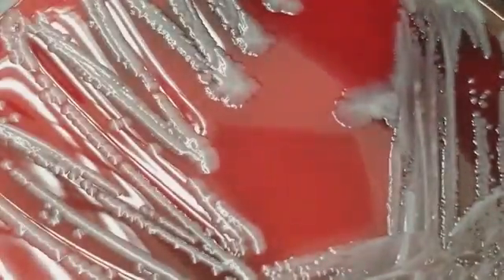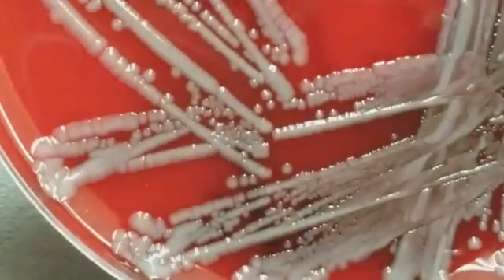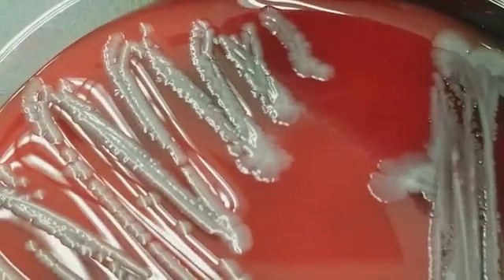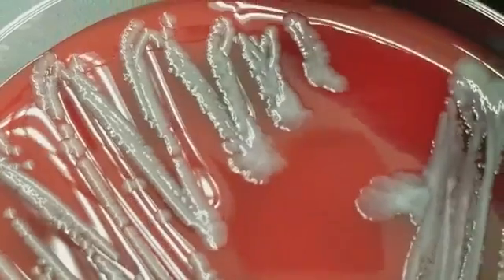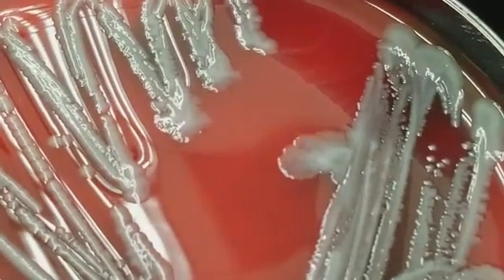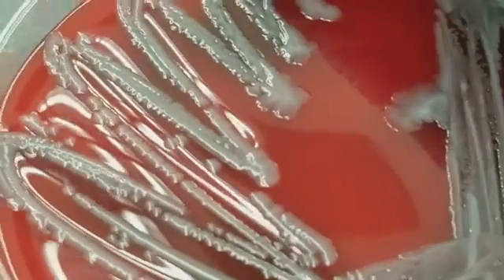This is from a sputum. Okay, ooh, this is so much different than what we've seen before. These colonies are a lot bigger. They spread out, but that's not swarming, okay? Please understand that's not swarming. They definitely spread out more, okay? And this is actually a gram-negative rod. This is going to be Klebsiella pneumoniae. I think that's what we have, yeah. Klebsiella pneumoniae, and this is actually antibiotic-resistant Klebsiella pneumoniae.